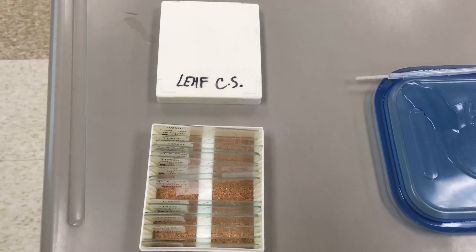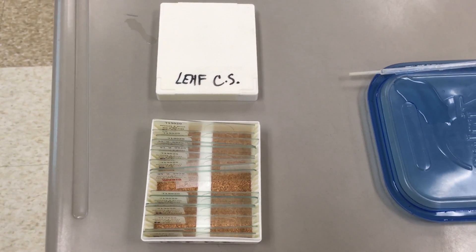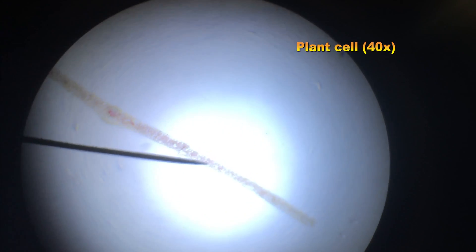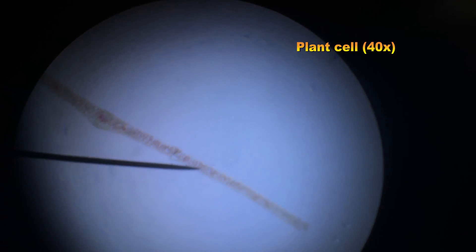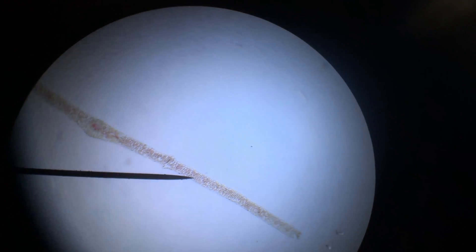The first cell we're going to be observing is the plant cell, and we're going to be looking at that from a leaf cross section. Here it is on scanning power. Not much detail to be observed, but you can see the structure of the leaf.